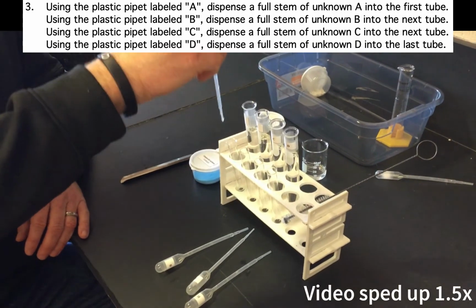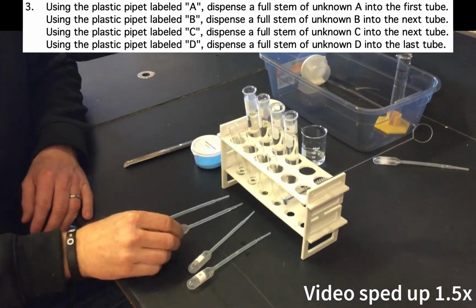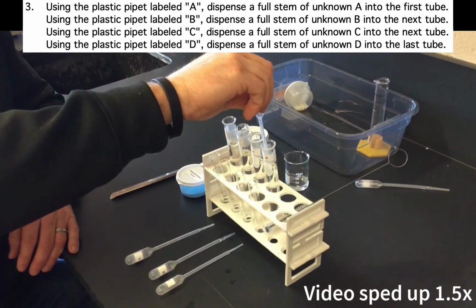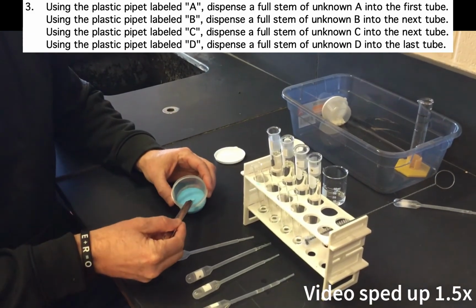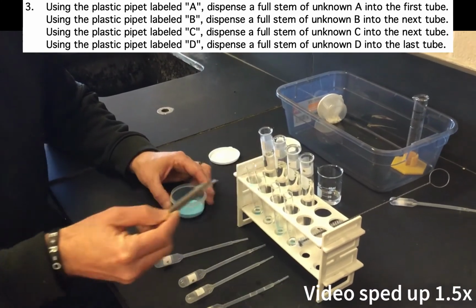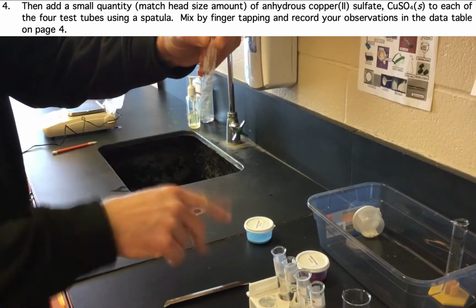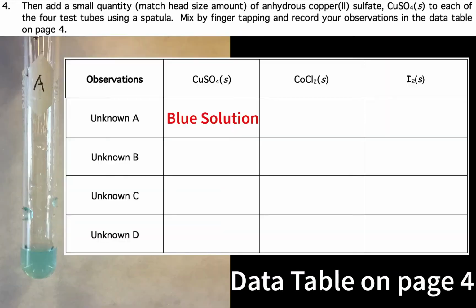We will now do these same 3 tests on 4 different unknowns and try to determine the identity of the unknowns by comparing our observed results to the actual results given to you on page 4 of the lab. We will start by doing the copper sulfate test on all 4 unknowns. Finger tap all 4 test tubes, make observations, and record these observations in the data table on page 4.